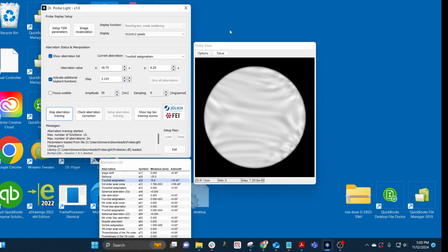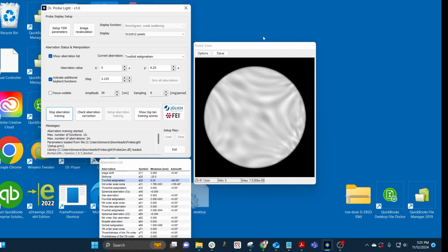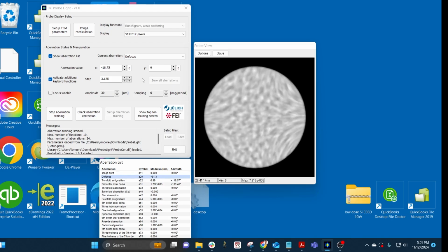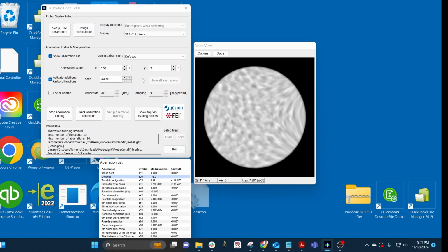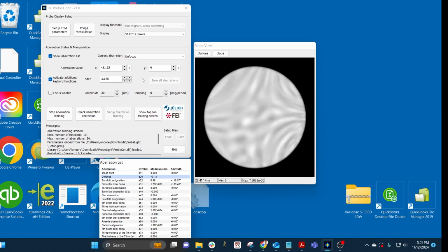So that's zooming out, so everything's getting smaller. I'm trying to zoom in all the time. Now this is roughly about right there, I'd say. Move in and out of focus. So we're pretty good now. I haven't actually measured the aberrations, but we're very, very close to where you would see nice atomic resolution from your probe-corrected STEM microscope.